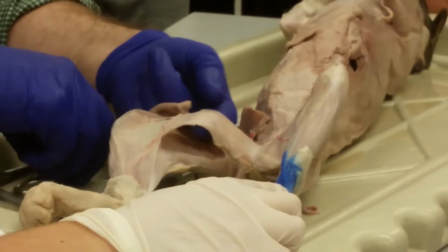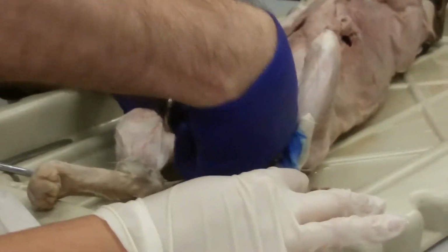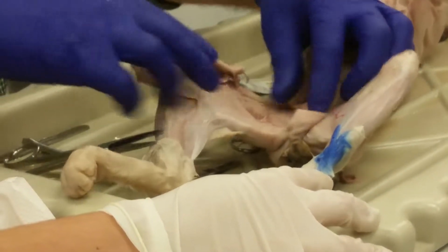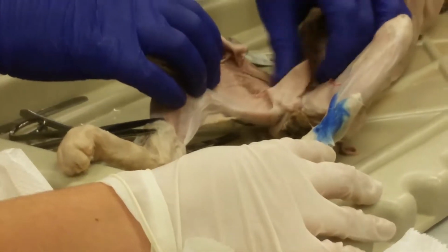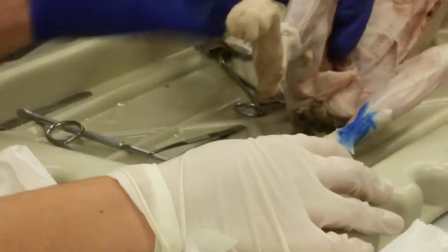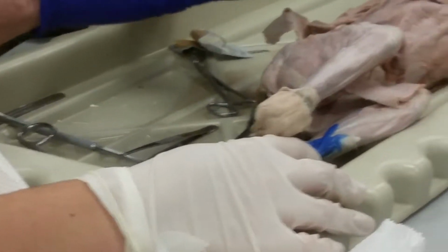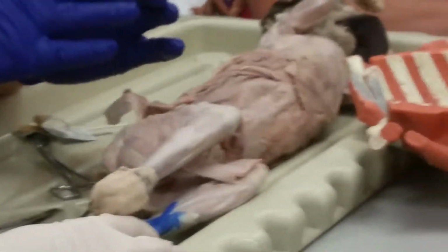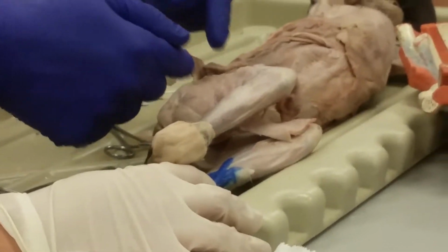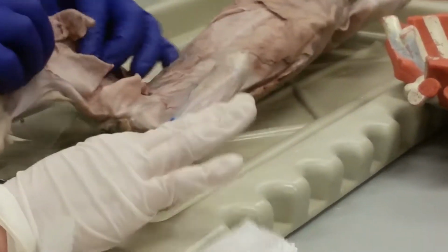All right, now this is another one we have to cut and reflect because we want to see the muscles that are deep to it. So I'm going to cut right there, reflect it, and I can see some other muscles. Now, there's an issue with comparing human to cat. Several issues, of course, but among them is that humans have round limbs and cats have flat limbs. So it's pretty clear what's medial, posterior, anterior in a human. In a cat, the lateral and the posterior and anterior get compressed into the medial and lateral. That's what I'm trying to say.